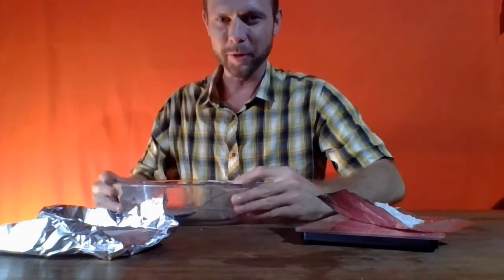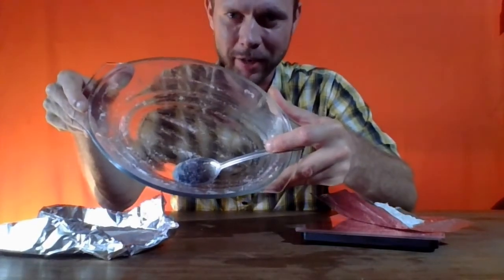Maybe the only solution is to add some water, redissolve the salt, and then recrystallize it, but we'd pretty much be right back in the situation where we started from. And this is actually just a general chemical principle. Again, I could have done a better job of scraping it clean, and yet no separation is ever going to be perfect.